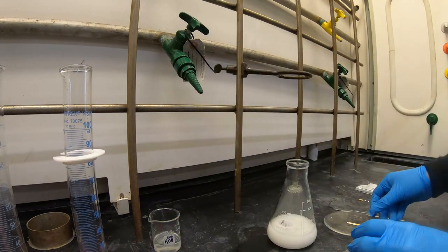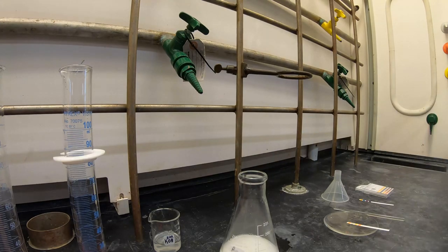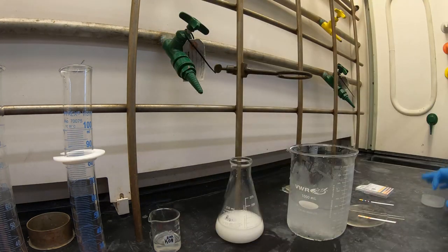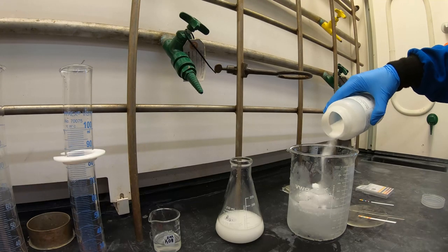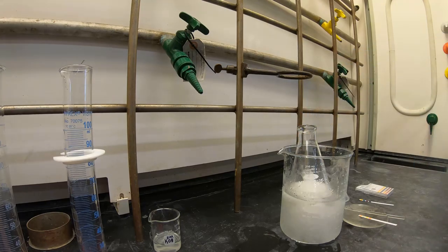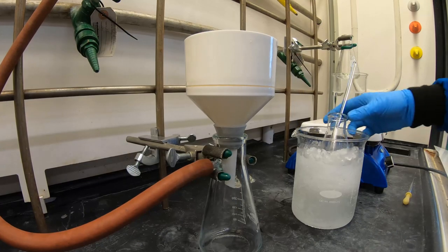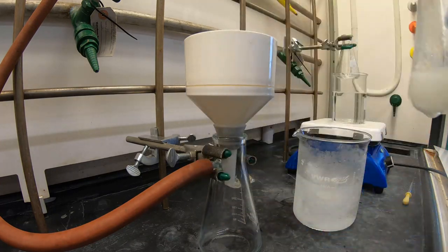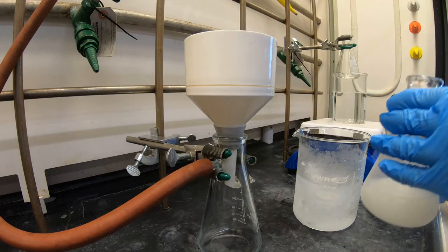If not, add small portions of KOH until you reach 10. Now make your salt ice water bath. Generously salt. If you do not add enough salt, then your water will not achieve the correct temperature to form crystalline lidocaine. This is important since it's fairly difficult to crystallize out lidocaine. It can take up to 30 minutes with vigorous scratching and agitation.